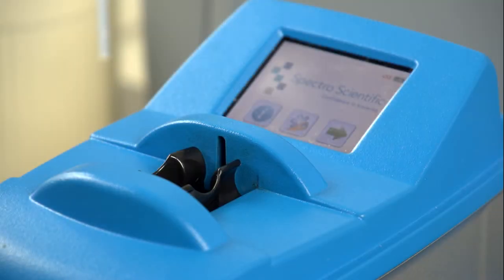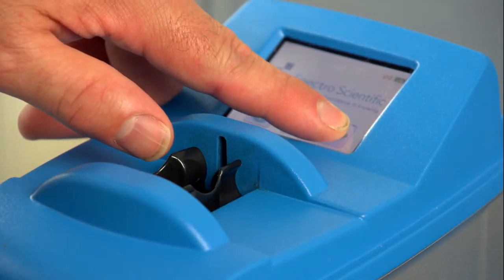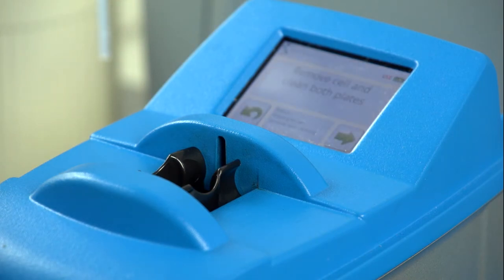Once the viscosity results are displayed, simply push the save button to transfer the data back into AMS.